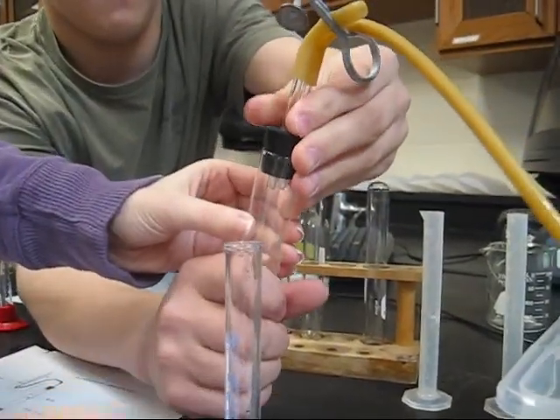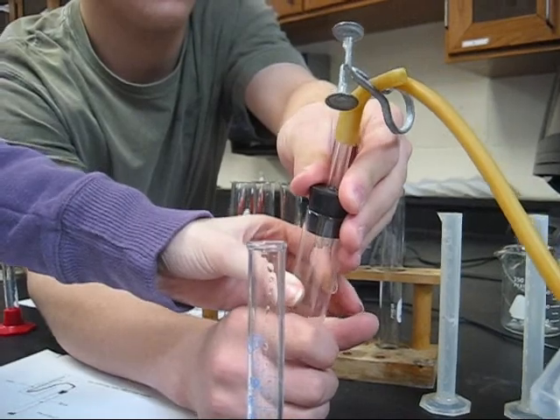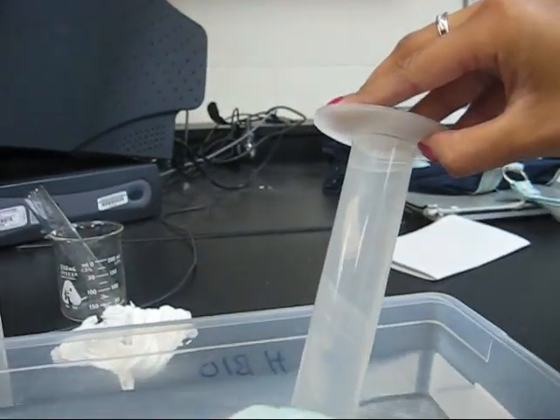Oh wait, it's slipping out. Oh. Okay, it's fine. Somebody hold it. There, if you want to.